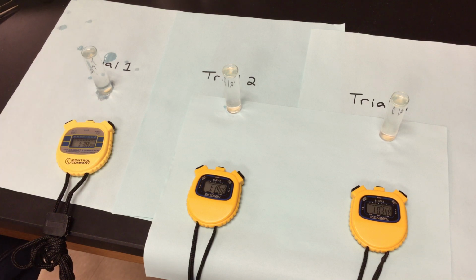So 4-minute maximum time. Once this particular trial is done, you guys should now have a data chart for all 5 pHs. We did pH of 3, 5, 7, 9, and this is 11 right here. You guys will be averaging each one of your pHs, and it's the averages that you are going to graph.